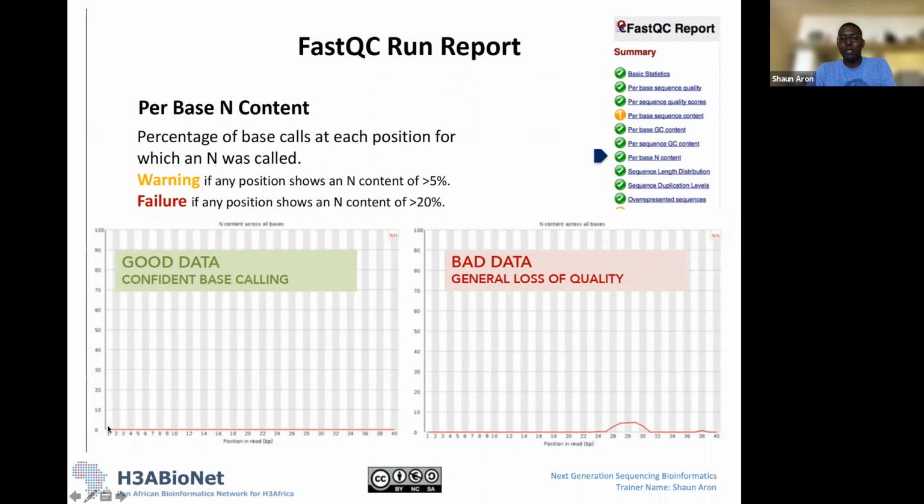We don't want to see any N's at any of those positions. Here's an example of something strange that's going on. Between positions 25 and 31, we're seeing N content in about 5% of our reads. This could be something to do with when the sequencing was happening with the samples. It could be library prep, where something strange happened with these particular fragments. Not lots of N's, but for this region you'll see that there are N's in the data set.